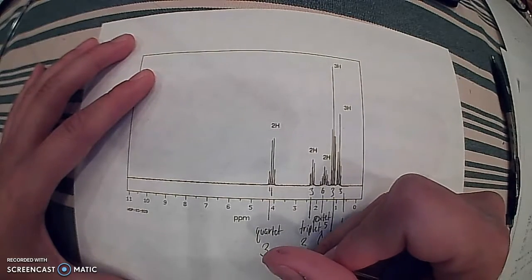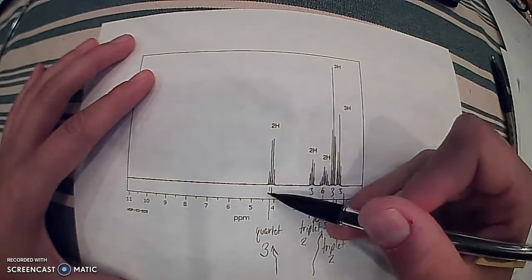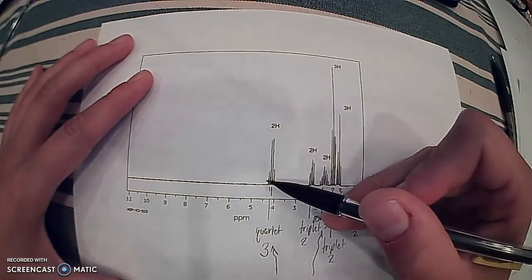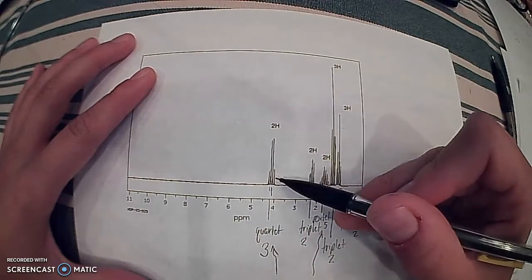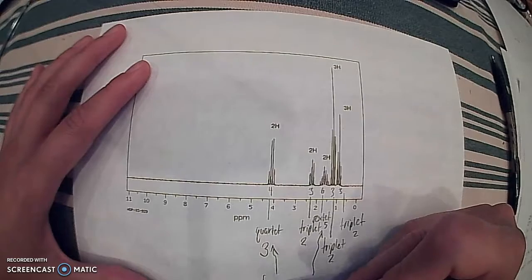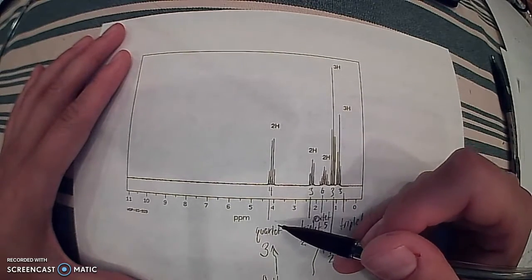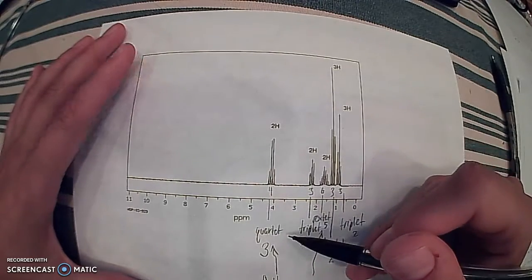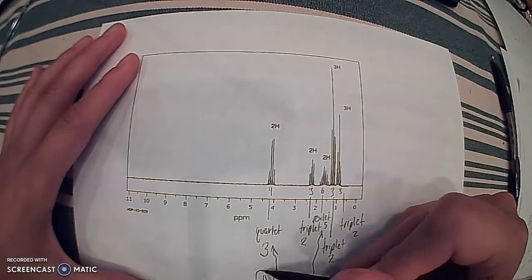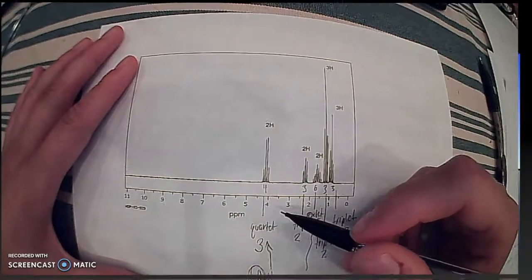And the other thing to look at is that this is quite high in the chemical shift, moving down towards the downfield portion of the graph, and this is an indication of a hydrogen bonded to an oxygen. Again, same concept as the carbon NMR: the magnetic field affects the electronegative atom, which is your oxygen, causing it to shift in your spectra here.